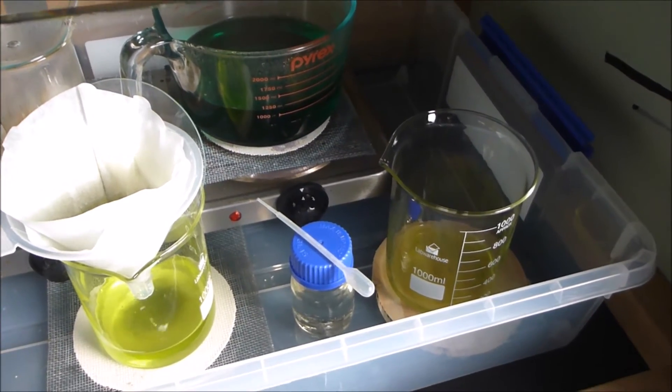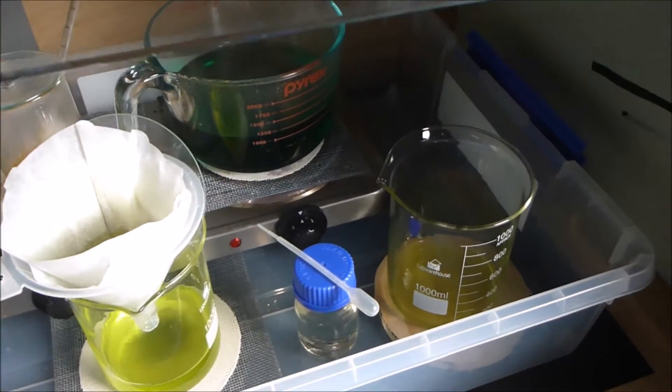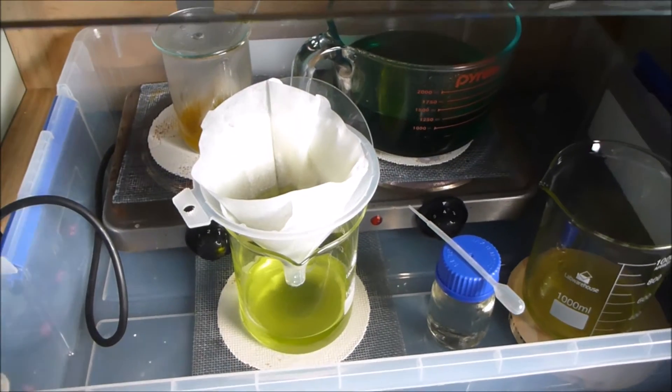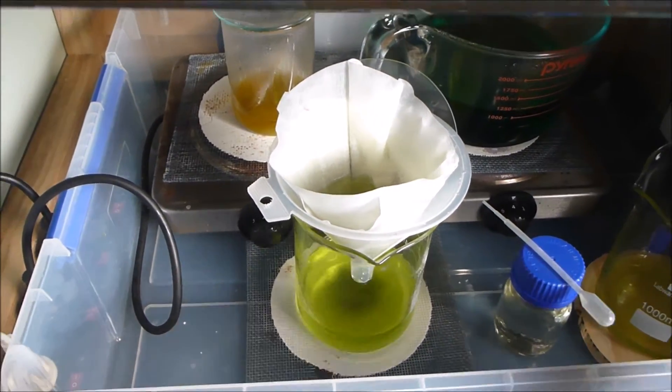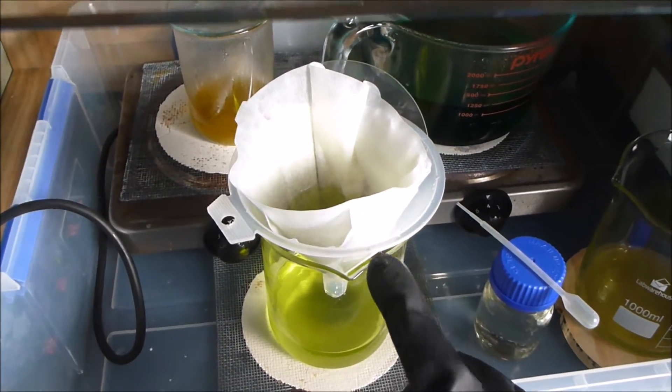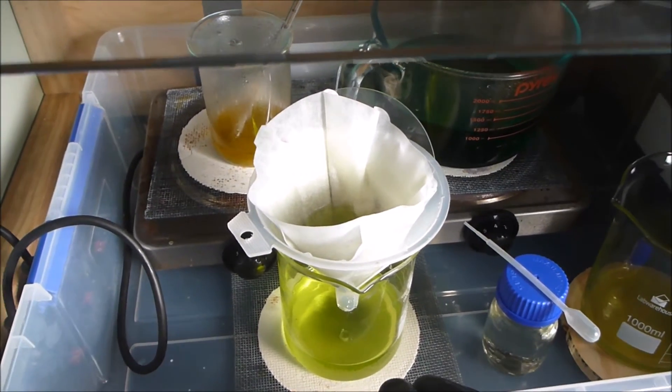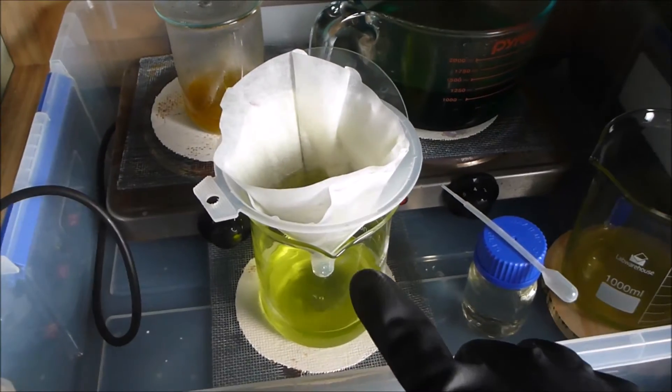The second approach to clearing up your solutions is what I'm basically doing here. I've got three coffee filters - two of the same type and one that is a different brand - and I am repeatedly filtering the solution from one vessel to the next using the same set of coffee filters.